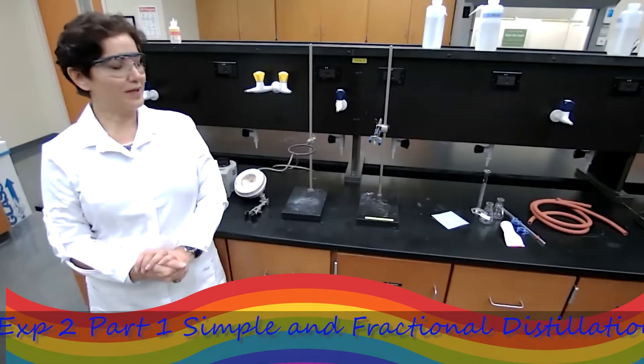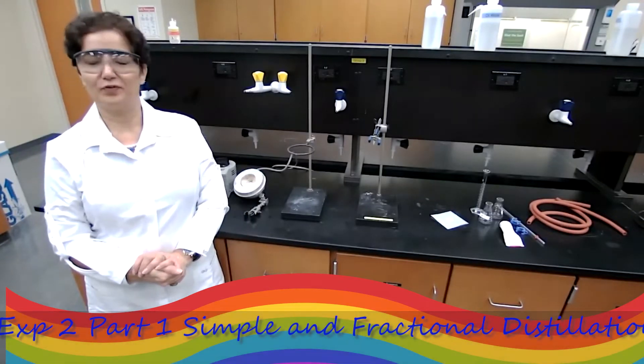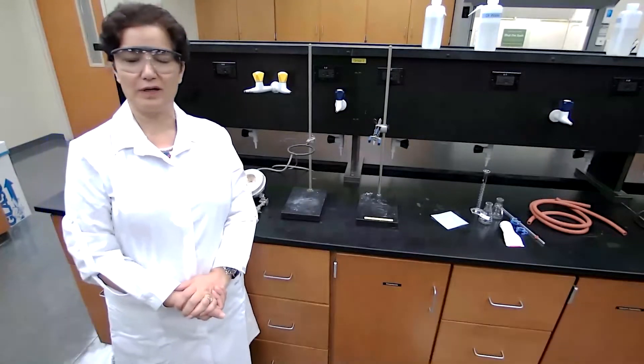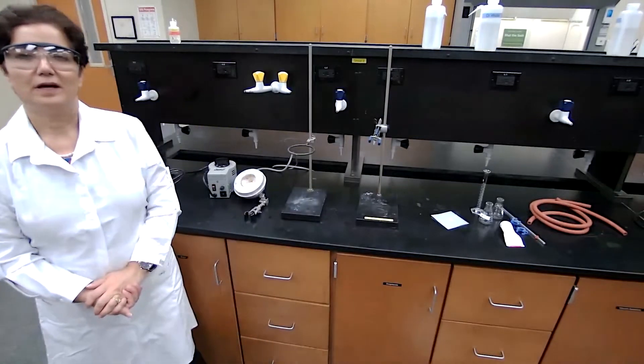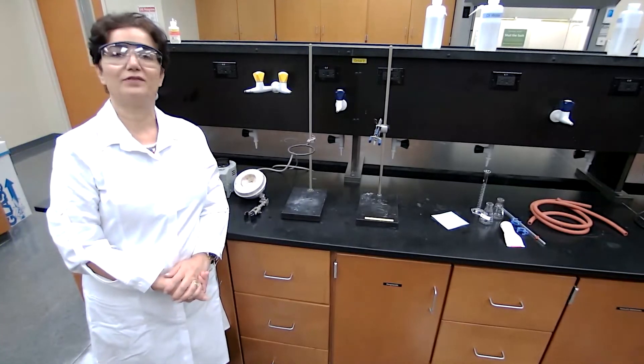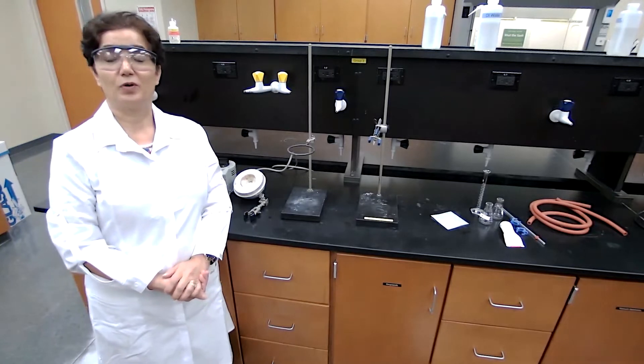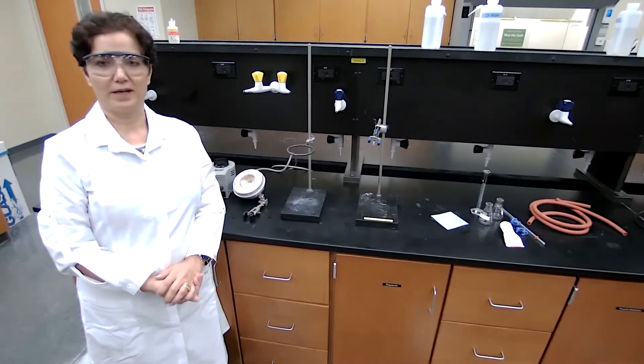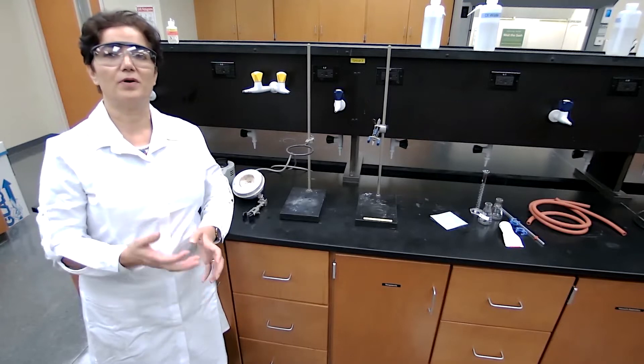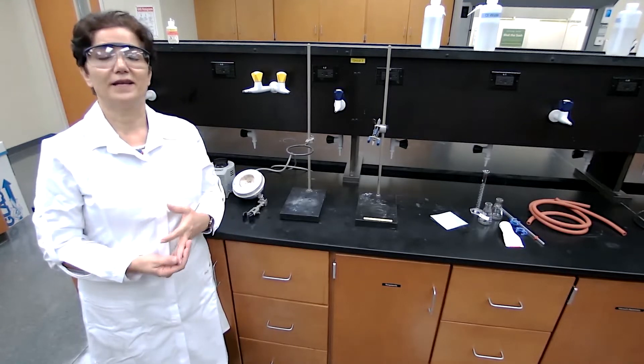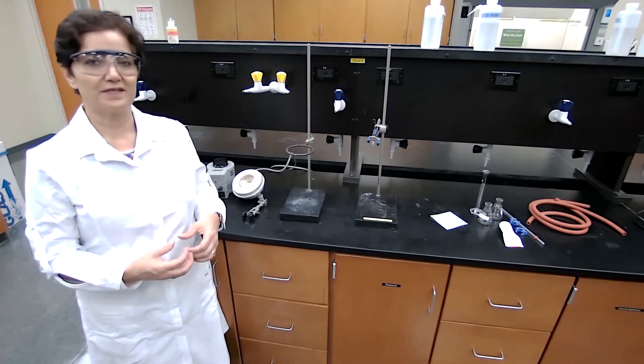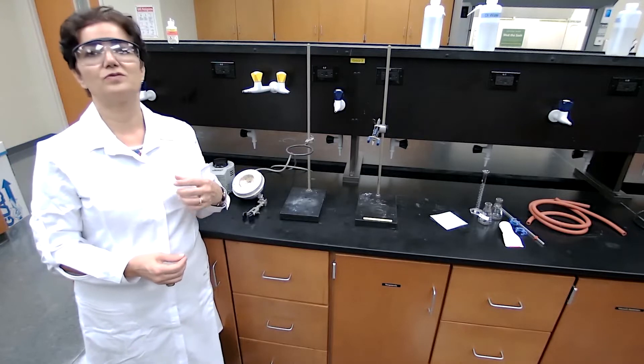It's Dr. Mamari again. I'm going to perform experiment two today, which is distillation. Distillation is a method for purification of liquids. You can separate liquids that have different boiling points, or you can separate the liquid from a solid. It depends on the difference in the boiling point of components of a mixture. We can use simple distillation or fractional distillation. There are other types of distillation that we are not going to work with.